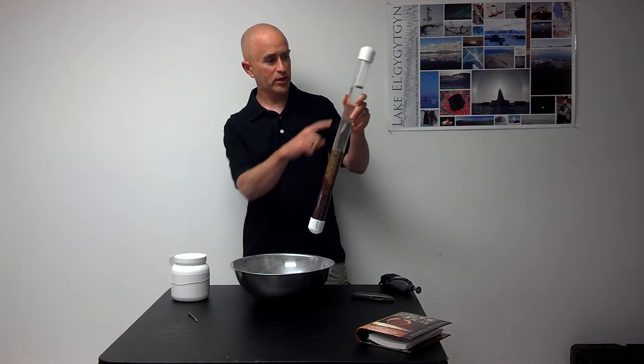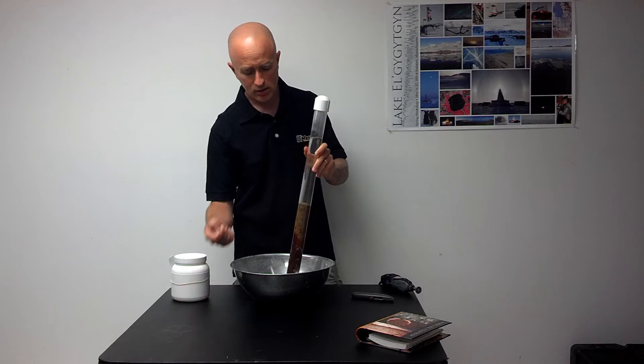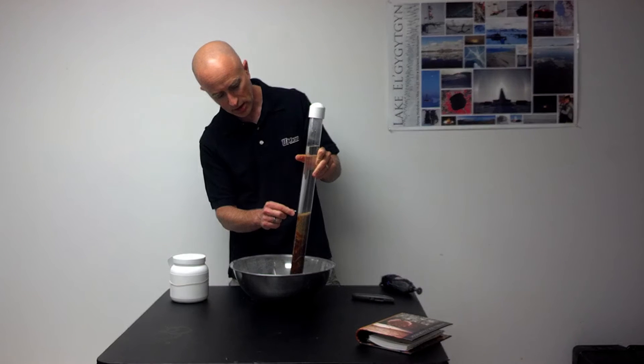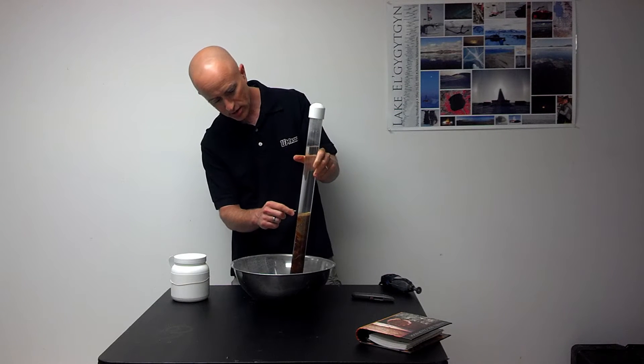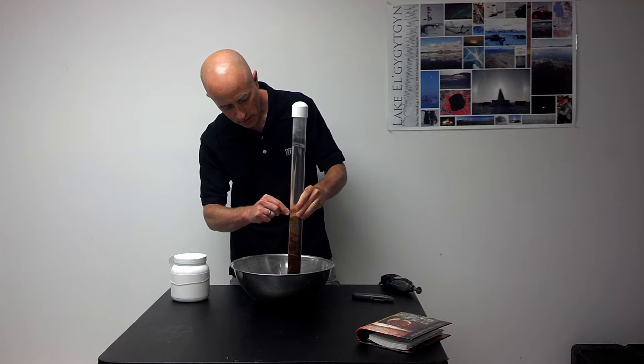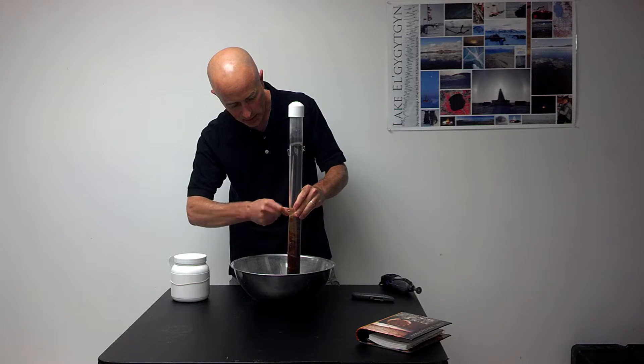The first step will be to drain off the excess water. With a sharp instrument, just like a sharpened nail, I'm going to make a hole just a centimeter or two above the sediment in my core tube.